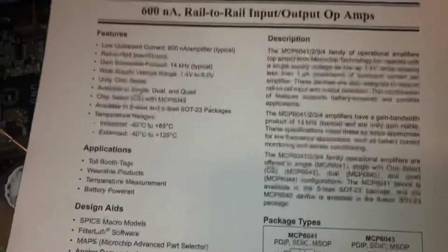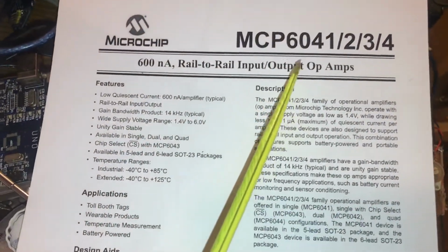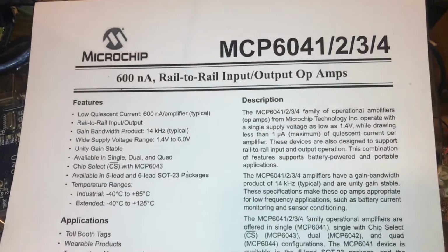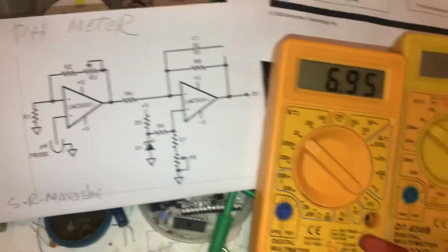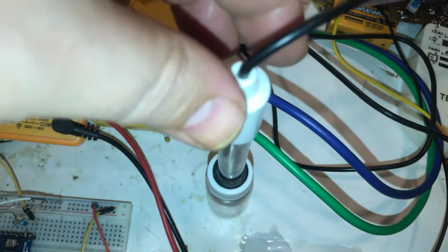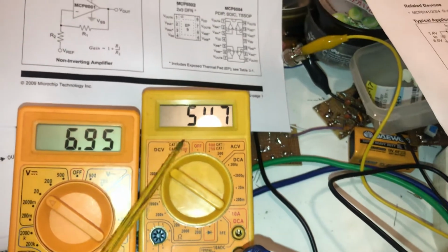But the other operational amplifier is MCP6041, a super sensitive 600 nanoamp rail-to-rail operational amplifier, and it is super comfortable for the pH meter. And as you can see, my electrode is in liquid, coming with 5.5 calibrated liquid, and exactly the direct voltage that I have is over the right meter.